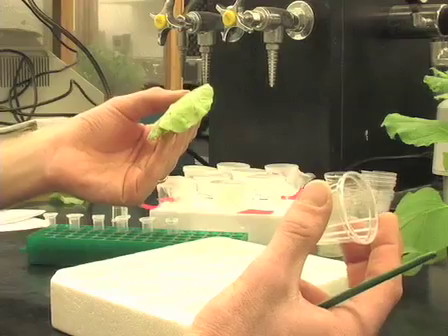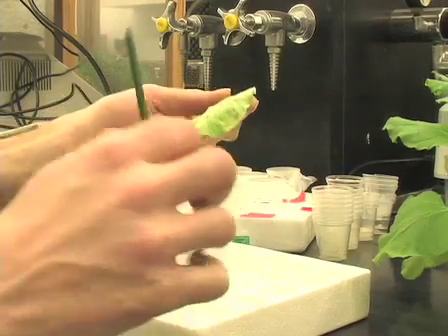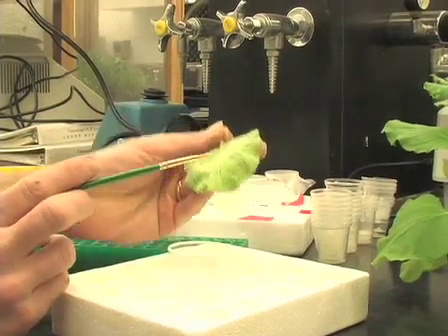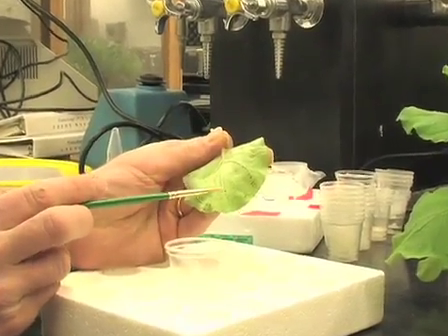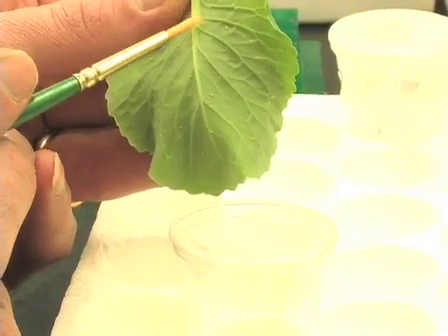Then four aphids are selected, either red or green, and put into these experimental cups. A paintbrush is used to delicately lift aphids off the leaf and put them into the experimental cup.